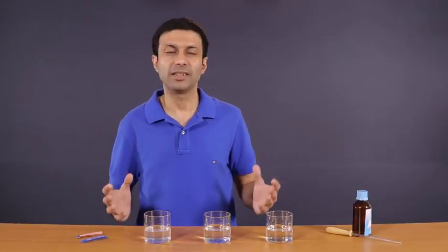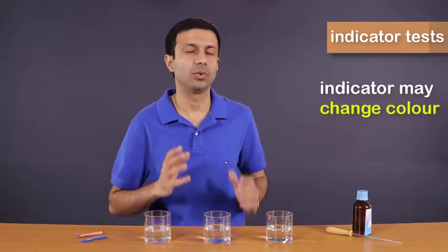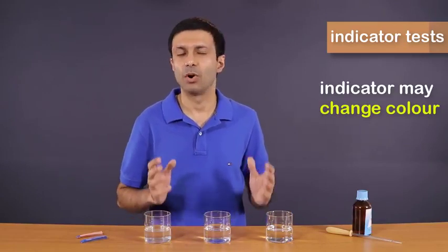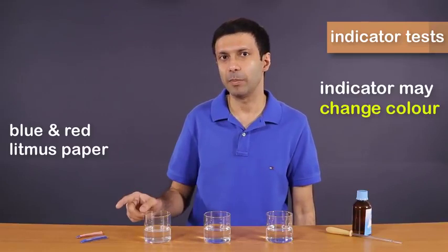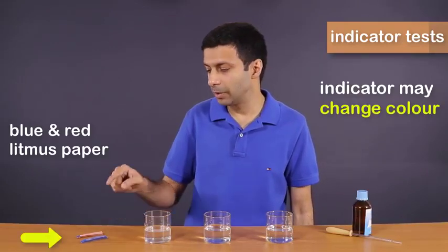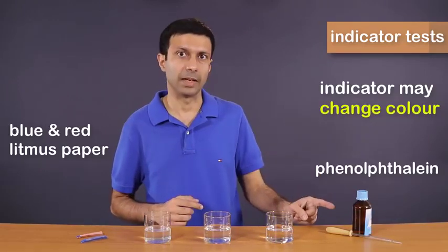Now let's take a look at indicator tests. An indicator may change its color when it's added to an acid, base, or salt. Here I have the two famous indicators, the litmus paper, so the blue litmus paper and red litmus paper, and here's the phenolphthalein indicator.